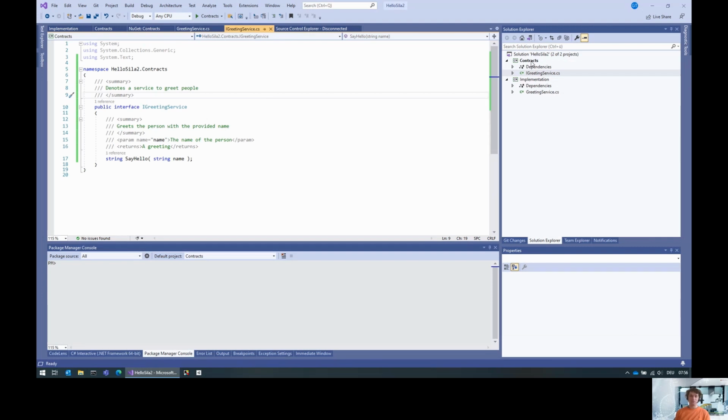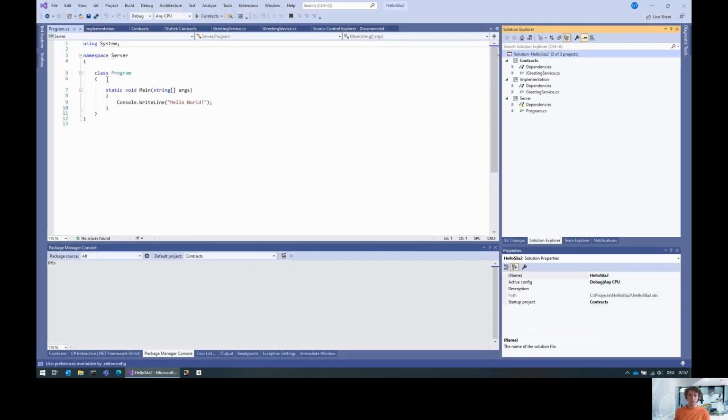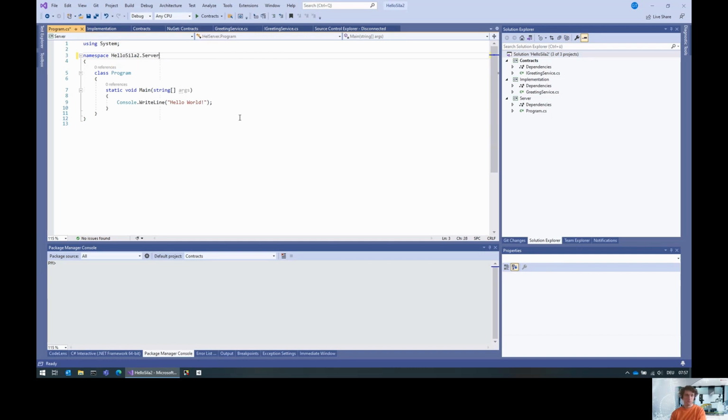So the first step to do this is to actually create a new project. We'll do a console application, which basically is the server application, using .NET Core 3.1. We can also change the namespace here. Then the next step is of course, now we need to include the SDK. What the SDK basically does is use dependency injection to find the implementation and connect that with a so-called feature provider, which is the code that determines how this functionality is exposed to SiLA 2, and this code is generated.